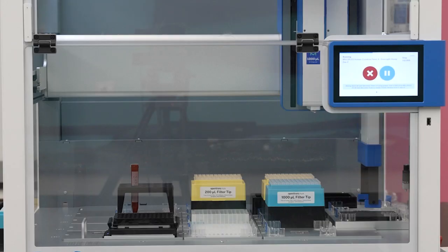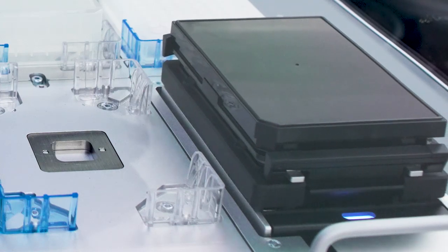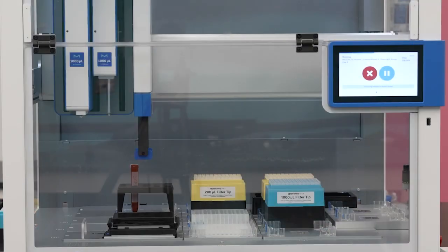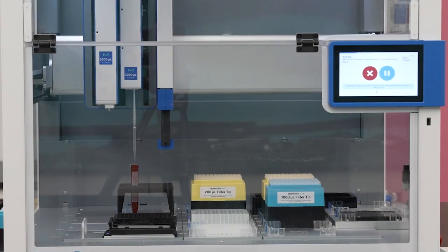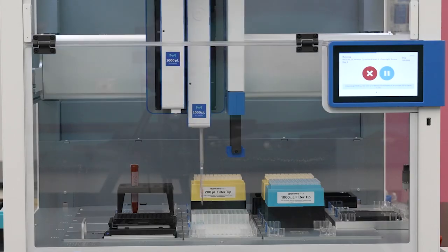The AAW Flex Gripper will place the black lid on the assay plate and then continue on to a 1-hour shaking incubation. After incubation, the gripper will remove the plate lid and continue on to dispensing and transferring the SAPE as done with the detection solution.